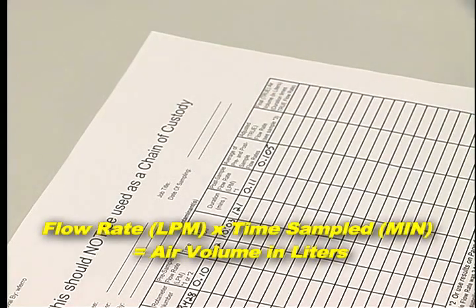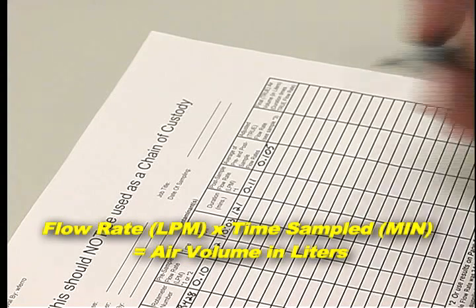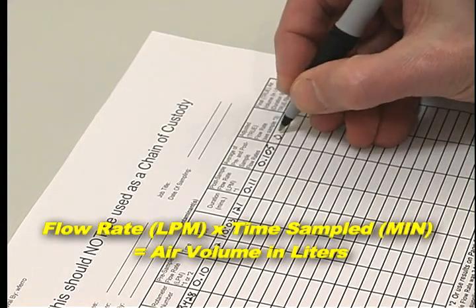Multiply the flow rate, LPM, by the total time sampled in minutes to get the air volume in liters.